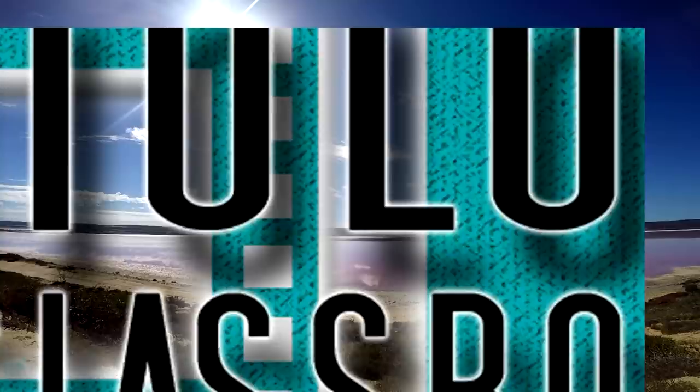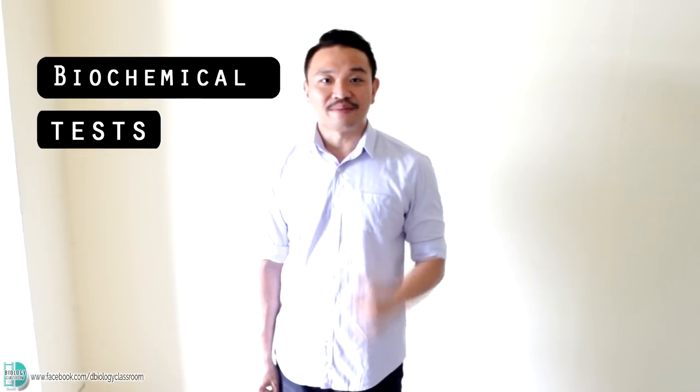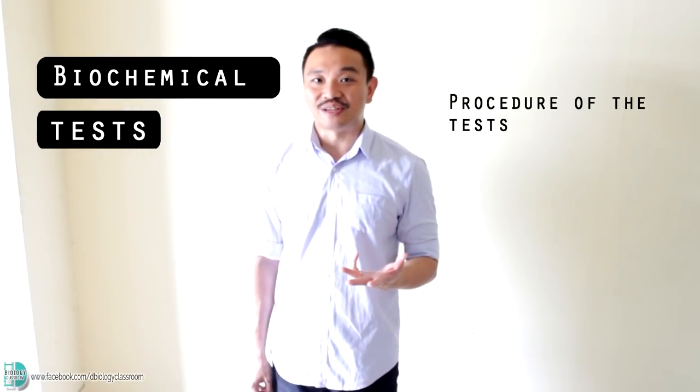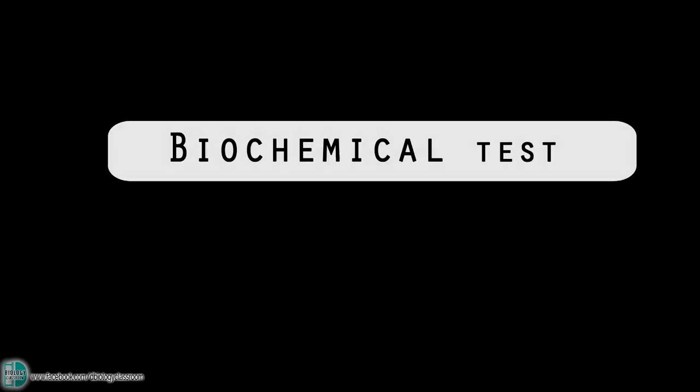Hi, I'm David and this is The Biology Classroom. This is a video about biochemical tests. I will show you the procedures of the test and give you explanations for the results.